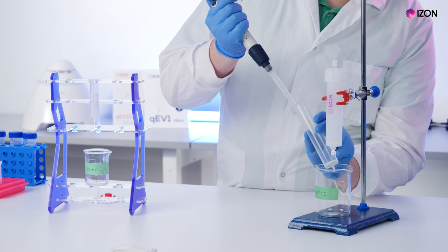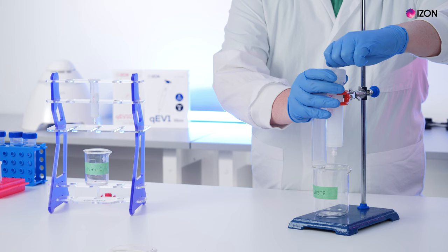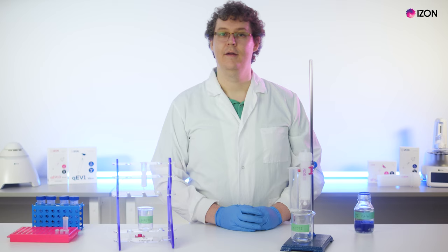For the QEV 2 or QEV 10, first wet the reservoir with enough buffer to fill the gap between the frit and the lower end of the column. Then remove the top cap from the column and check for any air in the junction.